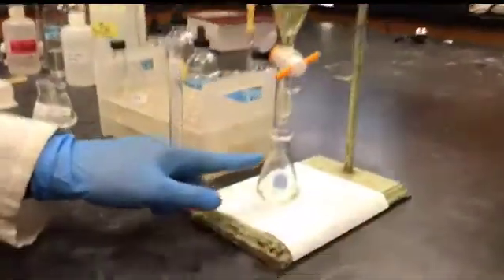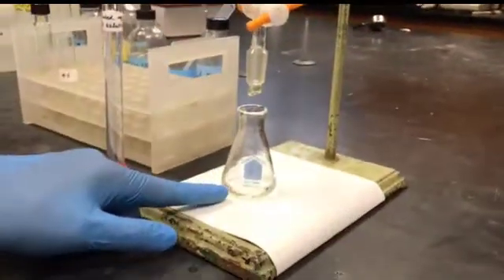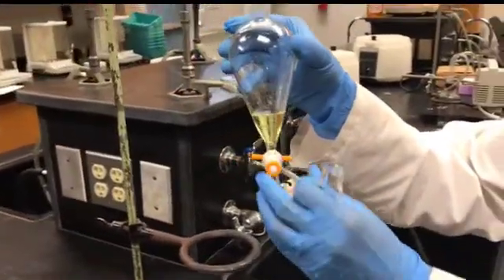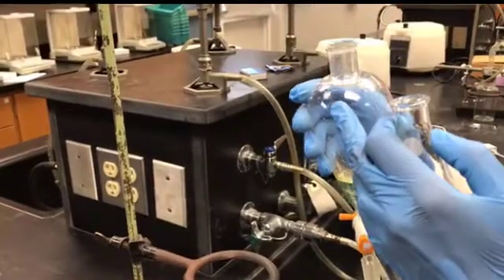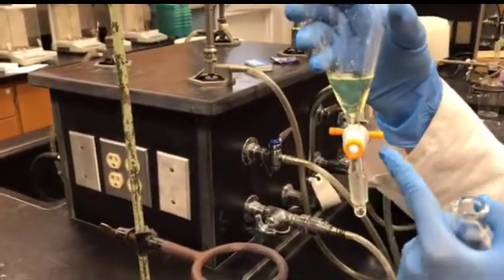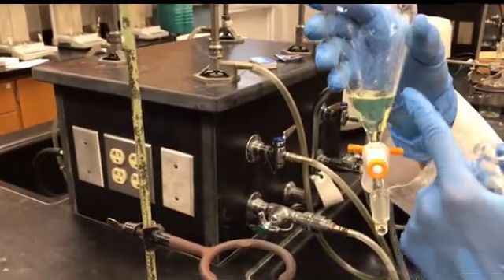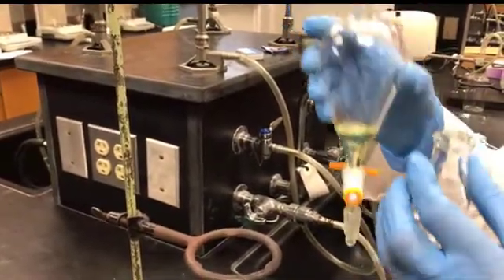So this is the lower aqueous layer containing brine solution, and that's the ether layer. This layer I'm going to discard. Now this has the ether layer, the upper layer. I'm going to remove the upper layer from the top of the separatory funnel, not from the bottom, because I have already removed the NaCl brine layer from the bottom. It's not good to remove the upper layer from the bottom because it has some water molecules in this portion, so it's good to remove from the top.